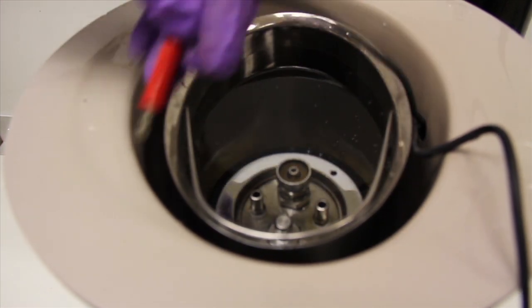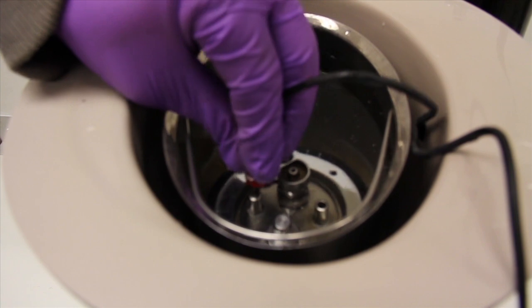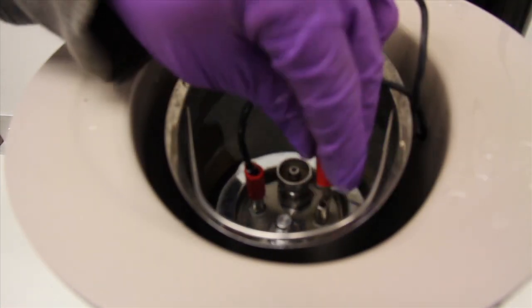There should not be any bubbles that leak steadily from the calorimeter. If this is the case, you will need to consult your TA for further instructions.